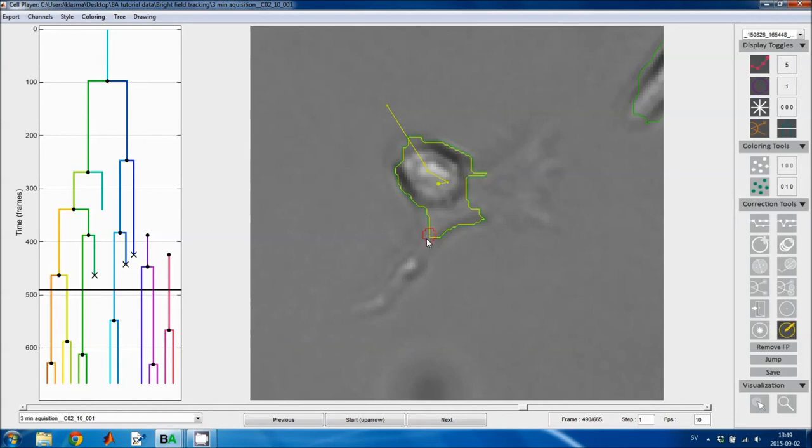If you left click, you paint more cell. So I'm painting this filopodia here. And I can paint the outline of this lamellipodia as well.